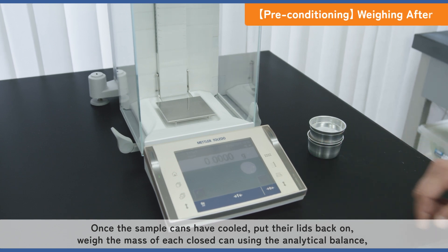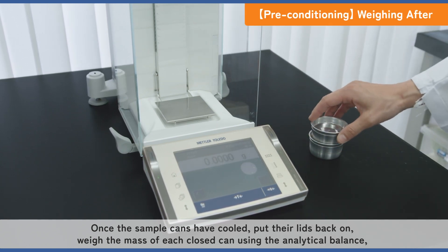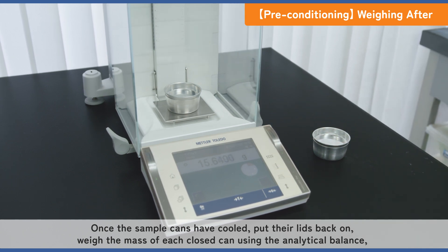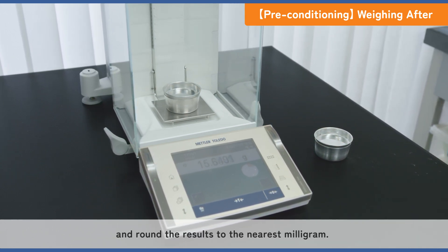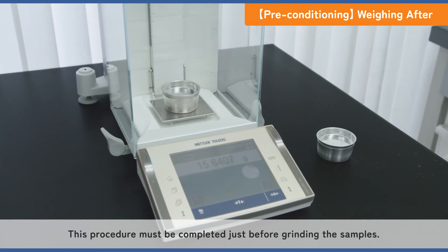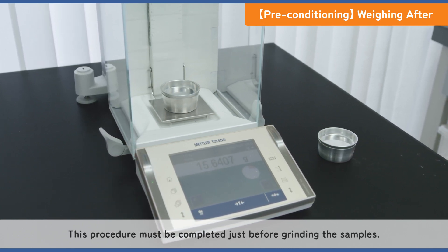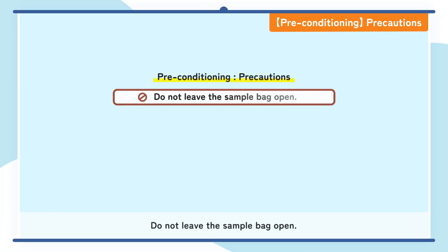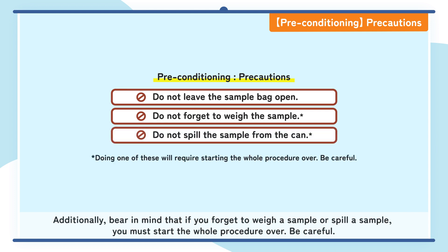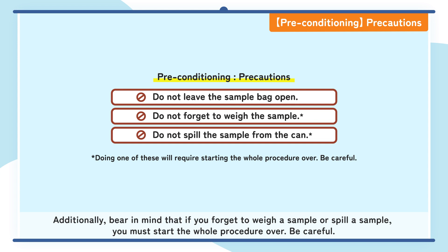Once the sample cans have cooled, put their lids back on, weigh the mass of each closed can using the analytical balance, and round the results to the nearest milligram. This procedure must be completed just before grinding the samples. Do not leave the sample bag open. Additionally, bear in mind that if you forget to weigh a sample or spill a sample, you must start the whole procedure over. Be careful.